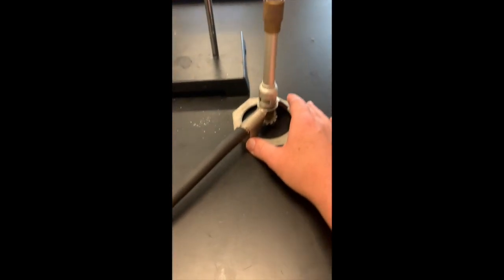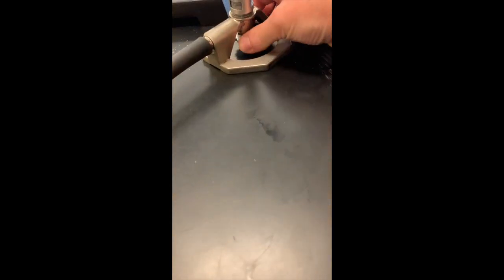Now that we have a working Bunsen burner, I'm going to open this up just a little bit more to get the flame a little higher.